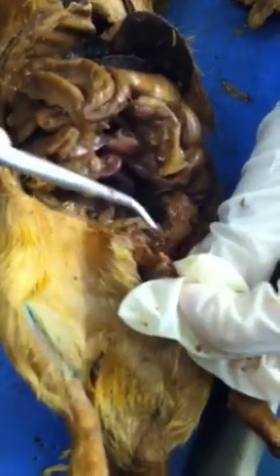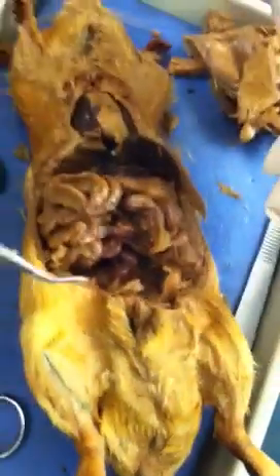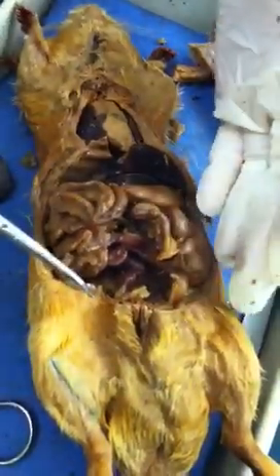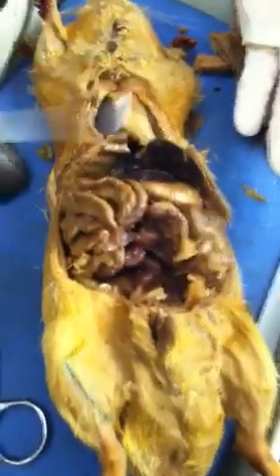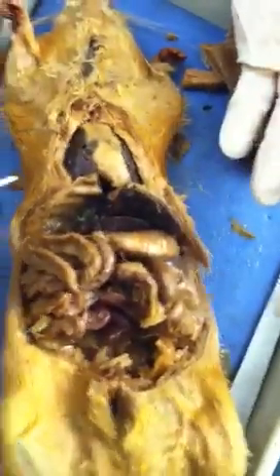The tip to study for rat dissection is to go through it by layers — from chest to abdomen — find the diaphragm first, and then figure out where each organ is. And that's it.